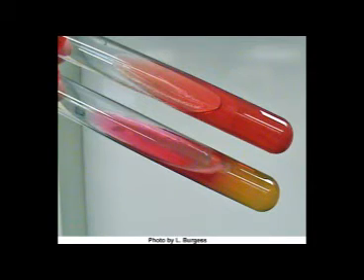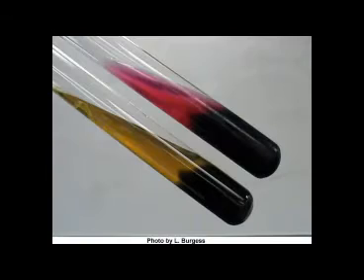Now shown is a property of some bacteria known as reversion. Reversion occurs with glucose-only fermenting bacteria. Since glucose is present in very low concentrations, it quickly runs out, causing the bacteria to revert to other forms of metabolism, such as protein catabolism. This will result in the bottom of the tube turning yellow from acid, a byproduct of fermentation, and the slant turning a bright pink because of protein catabolism that is occurring. The top tube is a control.